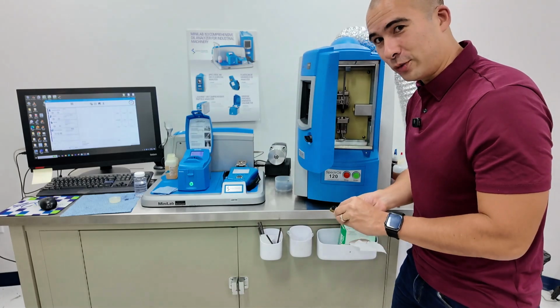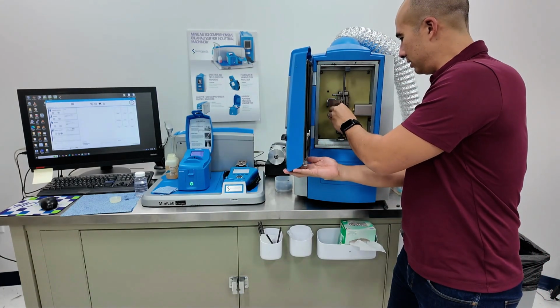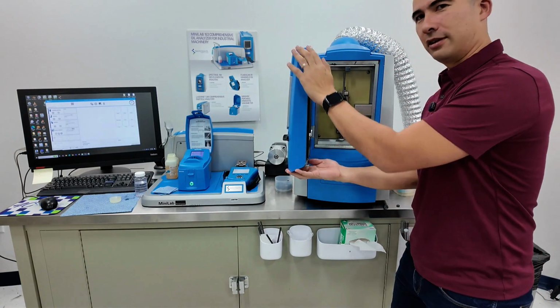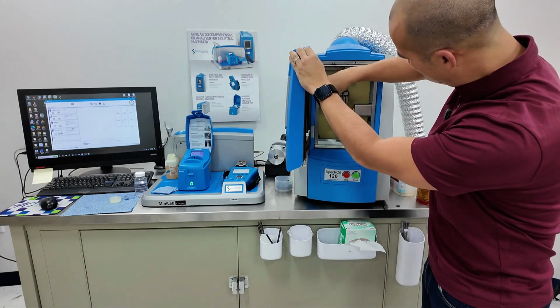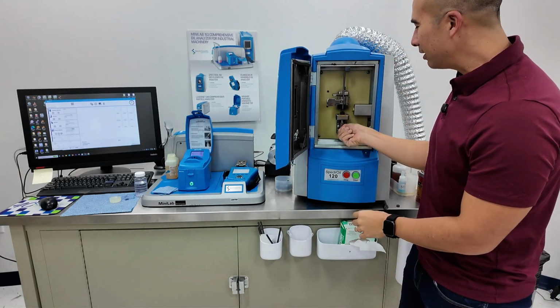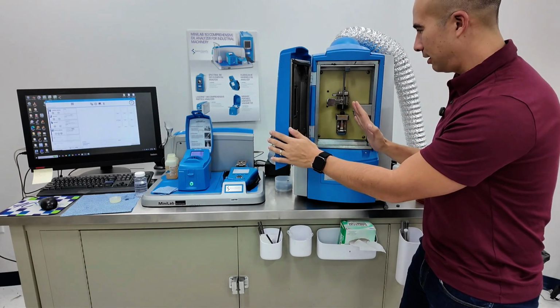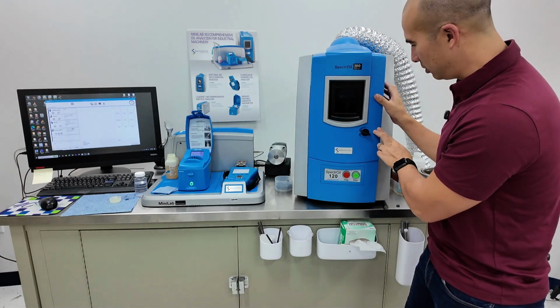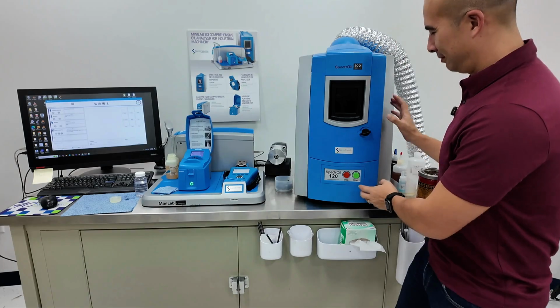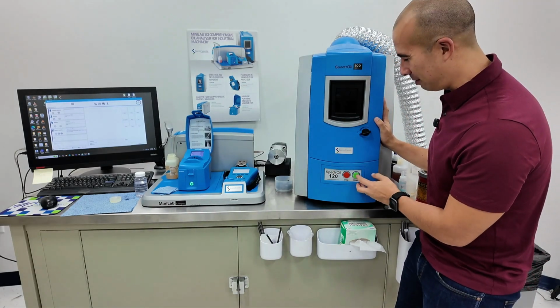Again, here's one we prepared earlier. That's going to go into the holder. And I just push this, whoops, sorry, and then I just pull this lever. Okay, so that's now submerged it in the oil sample. I think that's all good. Close the door. All right, and then we press start, and this is where the fun stuff actually happens.